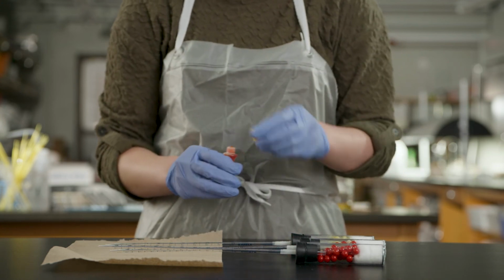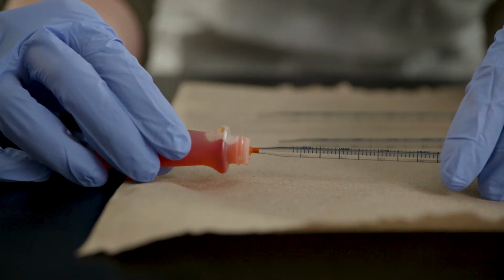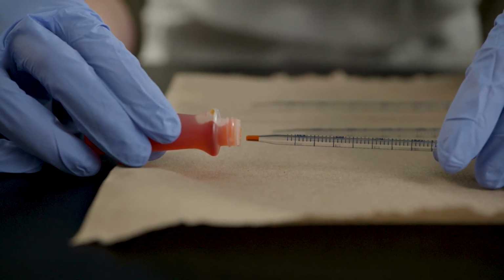To complete your respirometers, food coloring must be added to the pipettes. This will help you observe volume changes in the pipette during the experiment. Carefully lay the 3 assembled respirometers on a flat surface with the pipette tips positioned over a paper towel. Add some food coloring to the tip of the pipette by hanging a drop of food coloring from the bottle so that the drop just touches the tip of the pipette, and allow capillary action to pull the drop into the pipette. This will color any water that enters the pipette, so the demarcation between the air and the water in the pipette is easy to see.